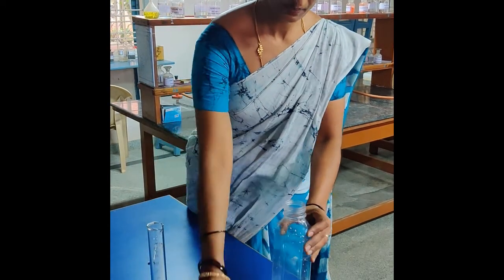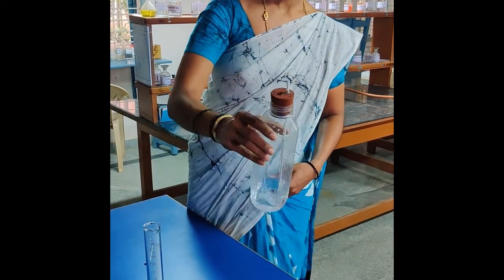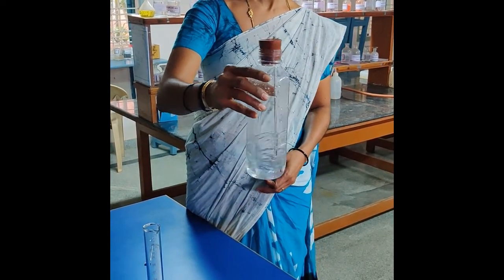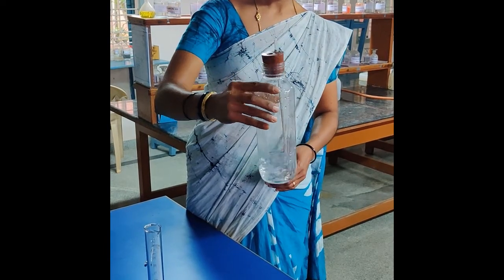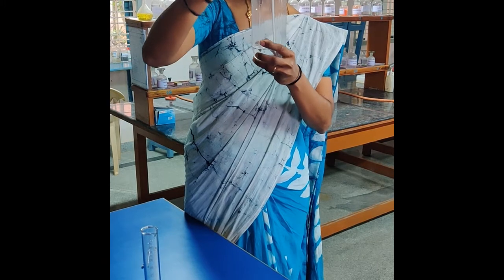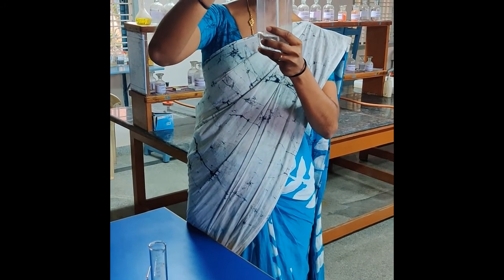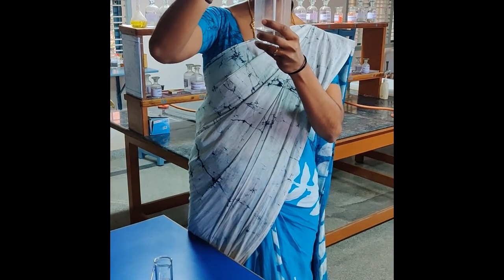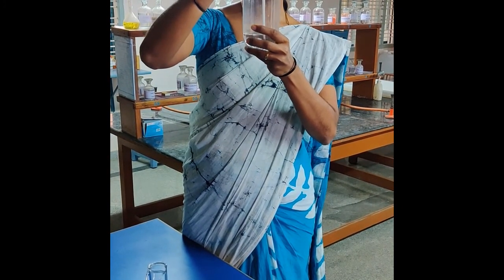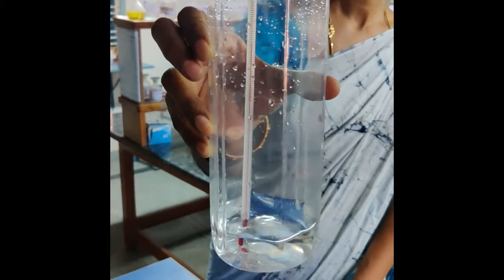Once I add 100 ml of water, I will close the bottle and note down the temperature. Let me wait for a minute so that the temperature remains constant. Now the temperature is constant — you can note down the temperature. The temperature here is 19 degrees Celsius.